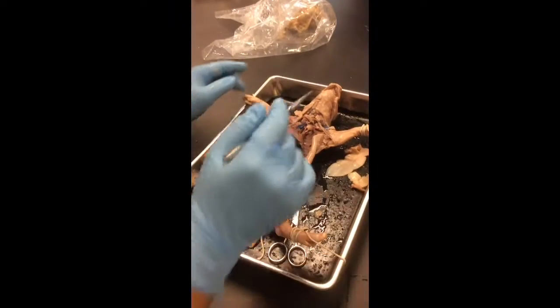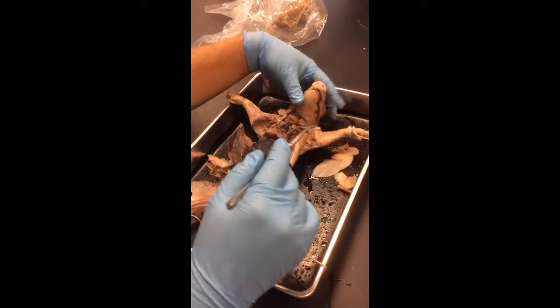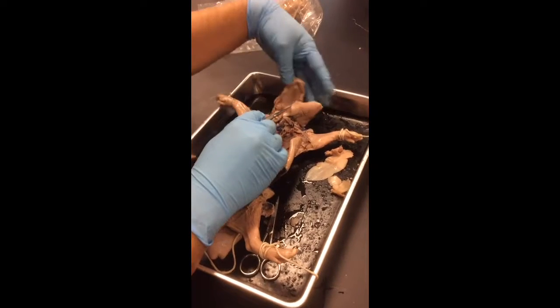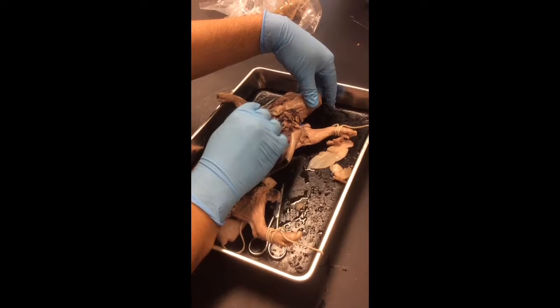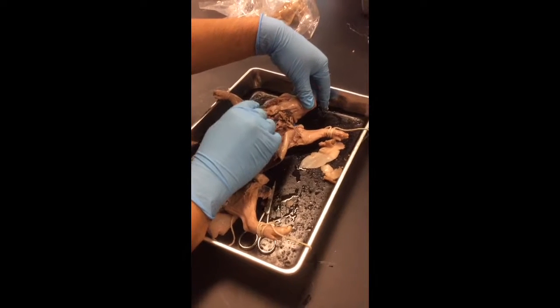Very top. Masseter muscle. Where's that? On the side. It's the cheek right here, right? The circular muscle that we all ripped through, so we're probably not going to have one, but it was that round muscle here on the side of the cheek. One, right? Yeah. That's the only thing you're going to have to know there.